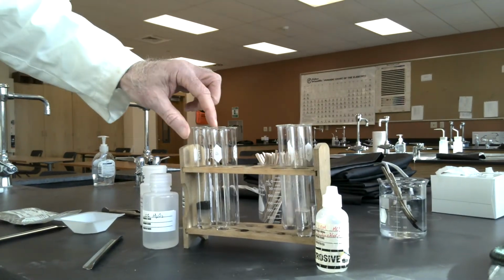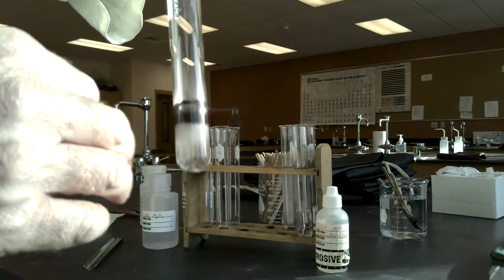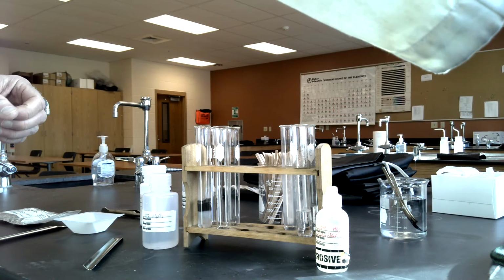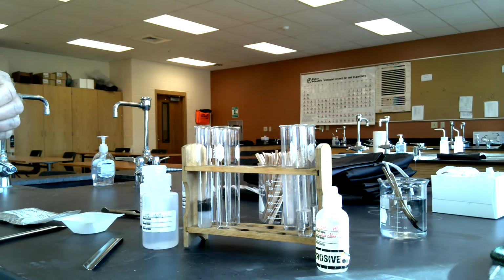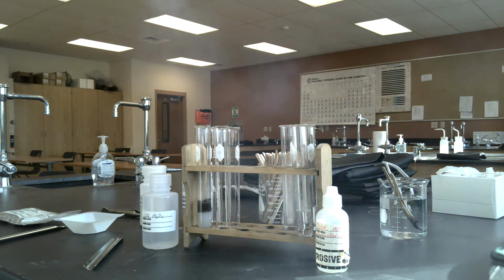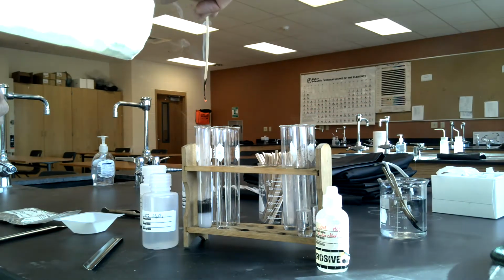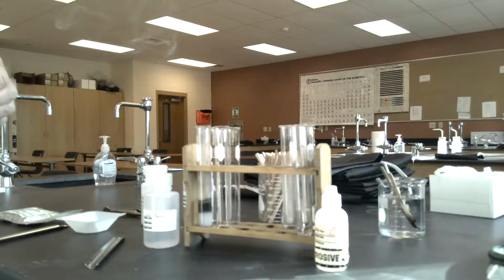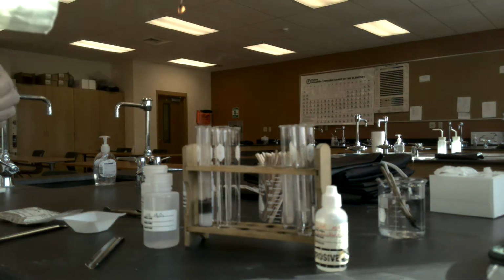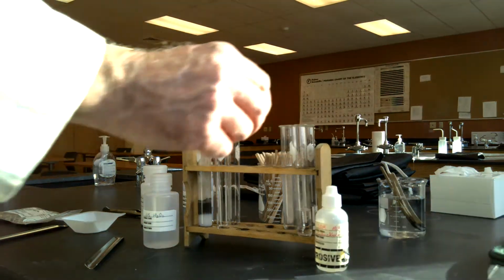And so I see that this is bubbling vigorously. So I can see that bubbling away. And that's getting warm. So we have evidence of a chemical reaction there. I'm going to let that gas generate for a little bit. I'm going to get a burning splint going, but I'm going to let it turn red. I'm going to insert that glowing splint. Oh, look what happened. Inserting a glowing splint, and it reignites. The only gas that can cause reignition of a glowing splint is oxygen gas.